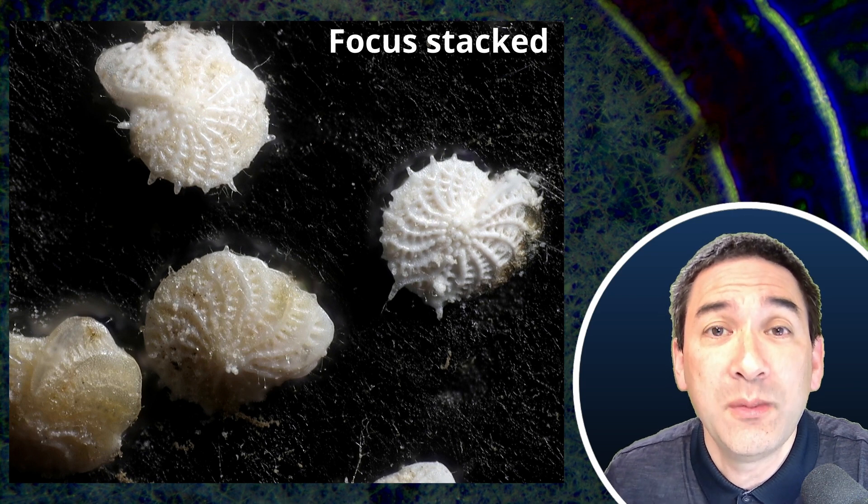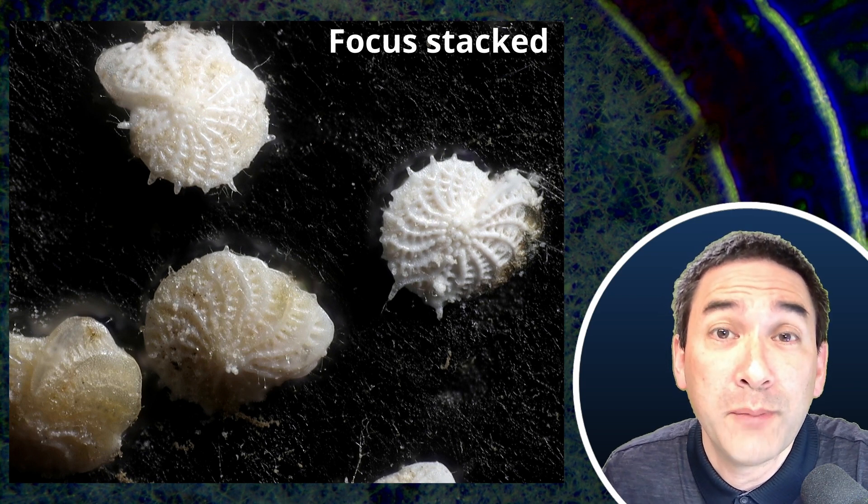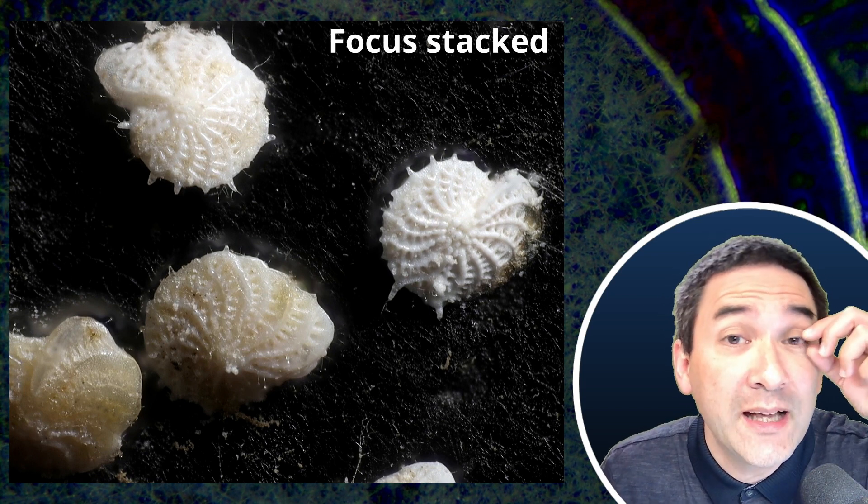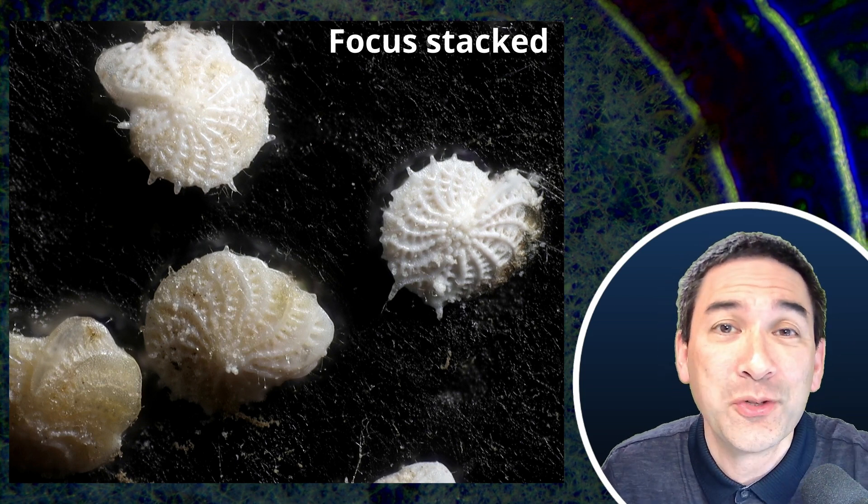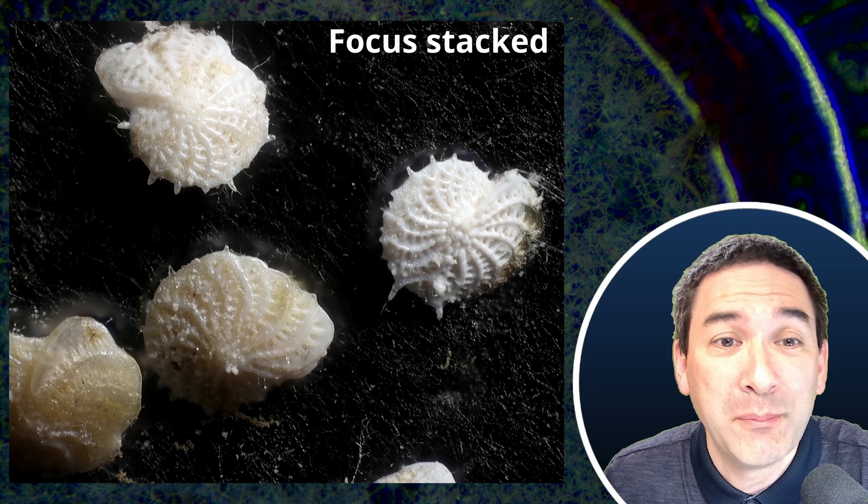And what people have done in the past when they tried to arrange them for microscopy is they pull out one of their eyelashes, which is very fine and pointed, and they use those eyelashes to move those tiny specimens around on the microscope slide.